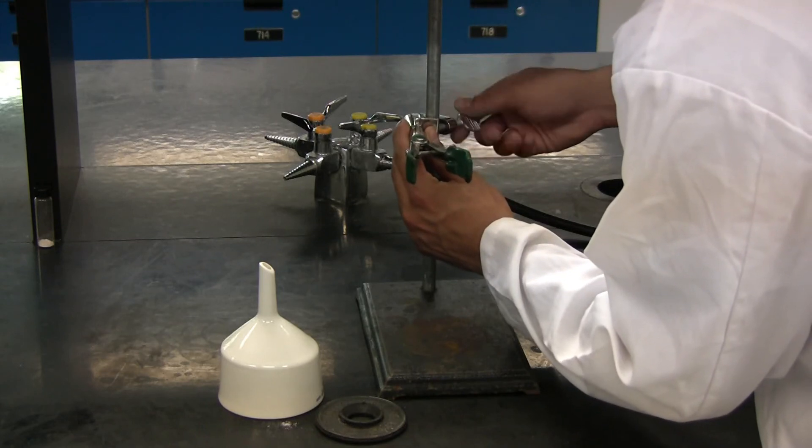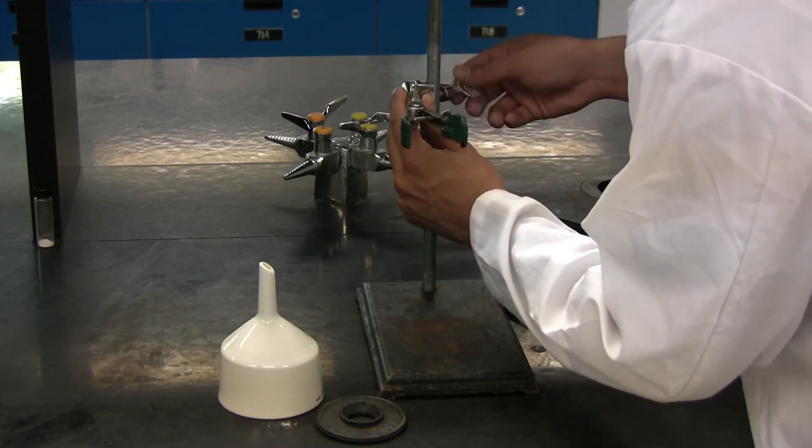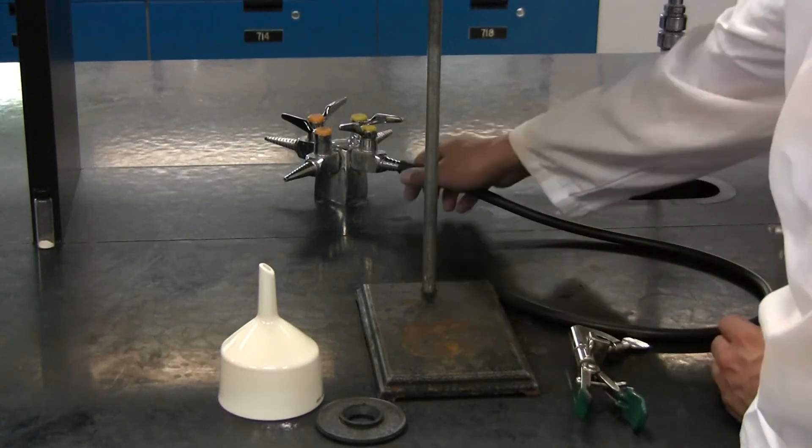Remove the clamp from the retort stand and make sure to thoroughly clean the Buchner funnel.